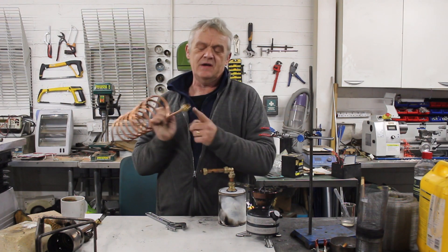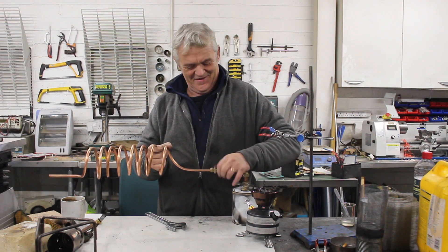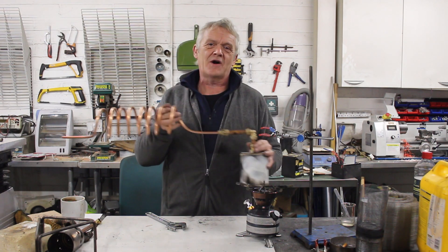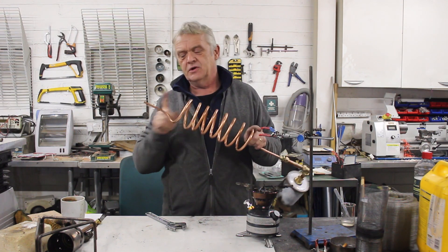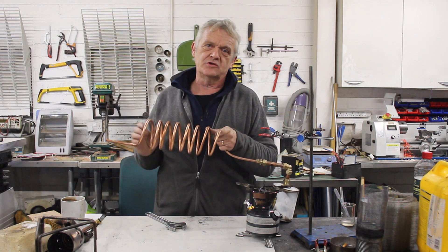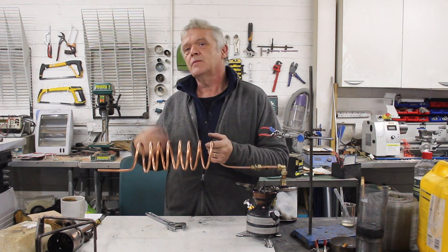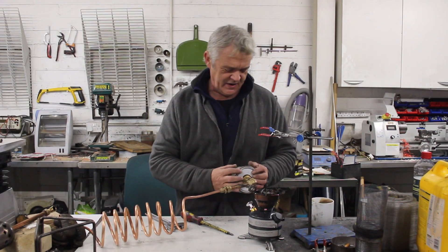I've put a plumbing fitting on here so it makes it really easy. There you go, bolt that bit on and we're ready to go. Now I have to fill this with a deciduous wood like I said, put a container to collect the liquid, and I'm just going to let it cool in the air. Obviously it's going to work better if we put a water jacket around that — run it through a bucket of water — because it'll help cool it a bit quicker. Okay, that's a load of oak twigs. Let's put the lid on and get some heat on it.